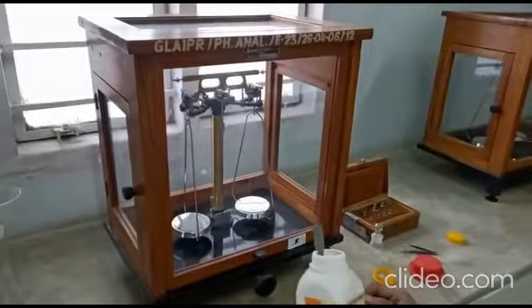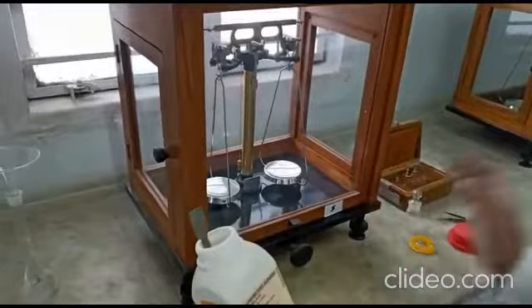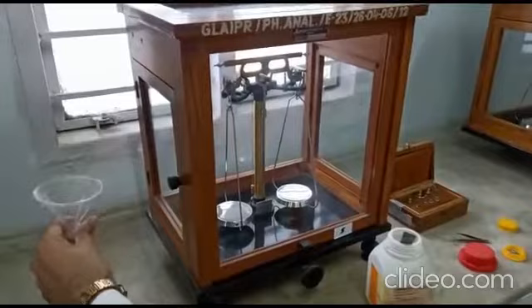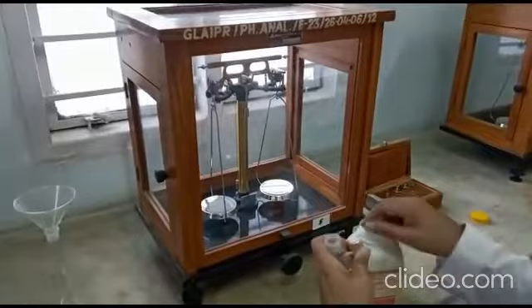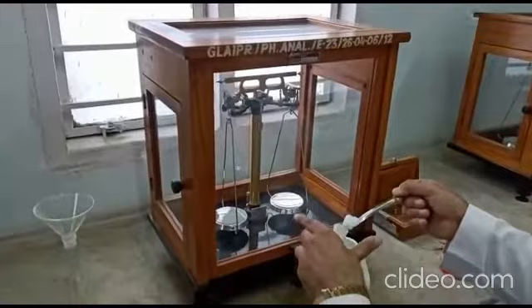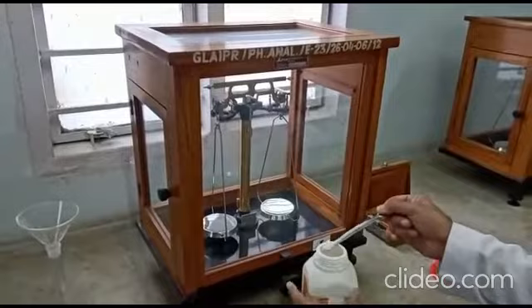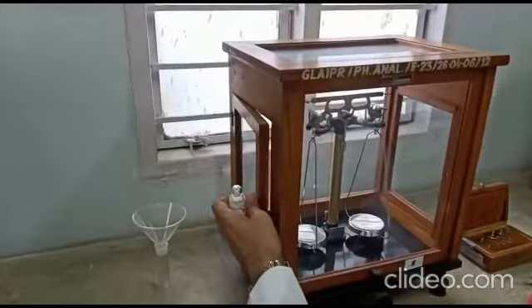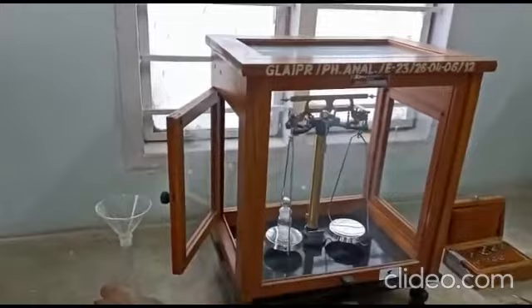Since this is a primary standard, it must be prepared in a volumetric flask — a 100 ml volumetric flask. We have the analytical balance, the weight box, the fractional weight box, the weighing bottle, the 100 ml volumetric flask, and the funnel. We take the oxalic acid from the reagent bottle and transfer it into the weighing bottle in excess. We need to weigh 0.63 gram, that is 630 mg.